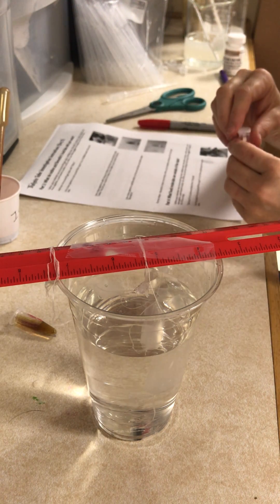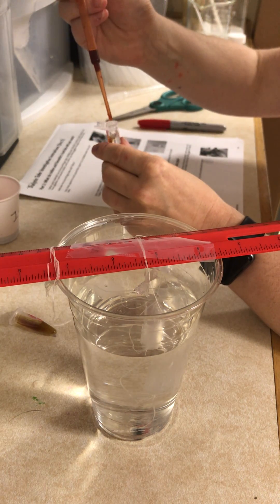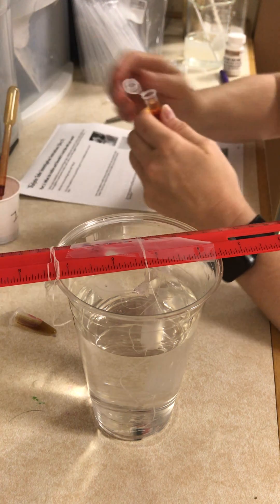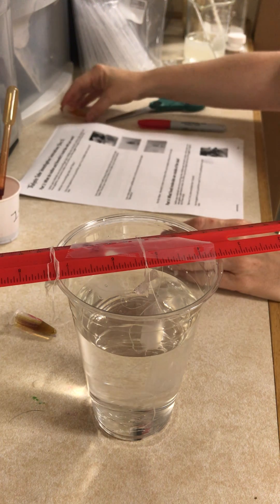On the first outside tube, just like I did before, I'm going to add five drops of iodine — one, two, three, four, five. I'm going to take that tube and put it off to the side.